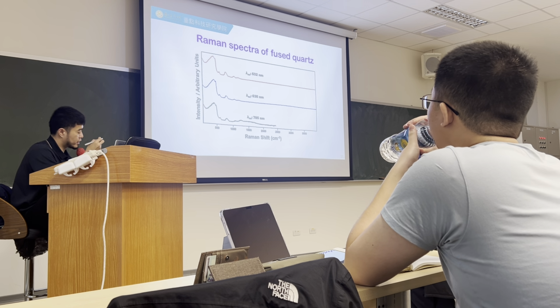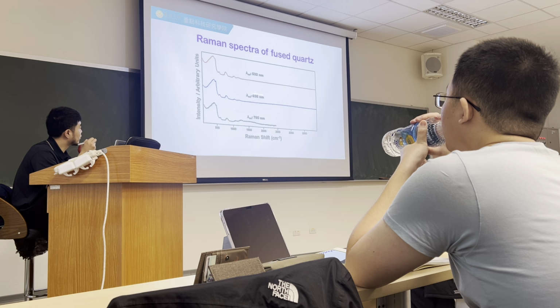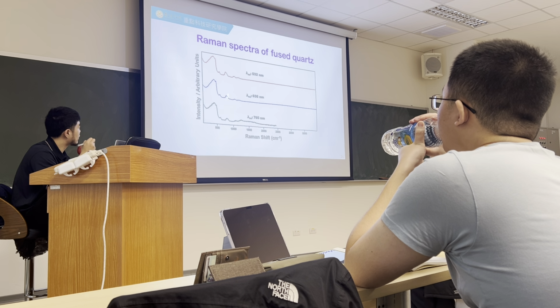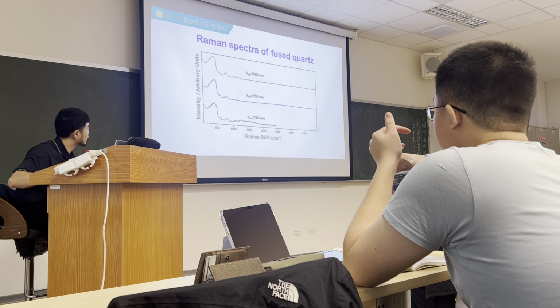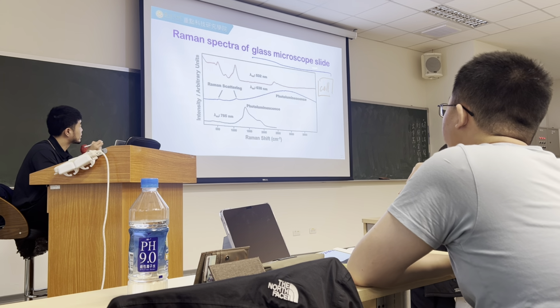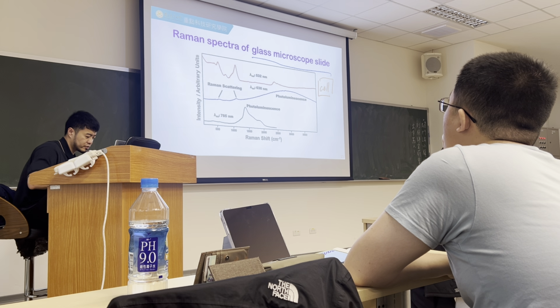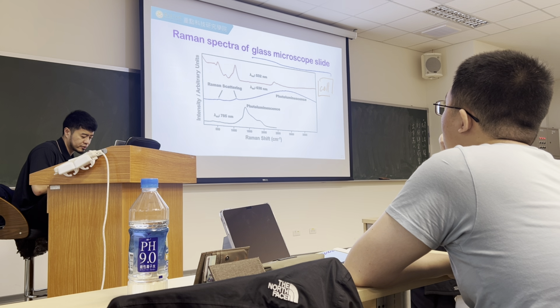As you can see over here, whenever you use quartz, there is nearly no fluorescence appearing in your spectrum. And you can observe relatively obvious Raman scattering as compared to whenever you use the glass slide. So here is another example to let you know how the fluorescence or photoluminescence influences your spectrum.